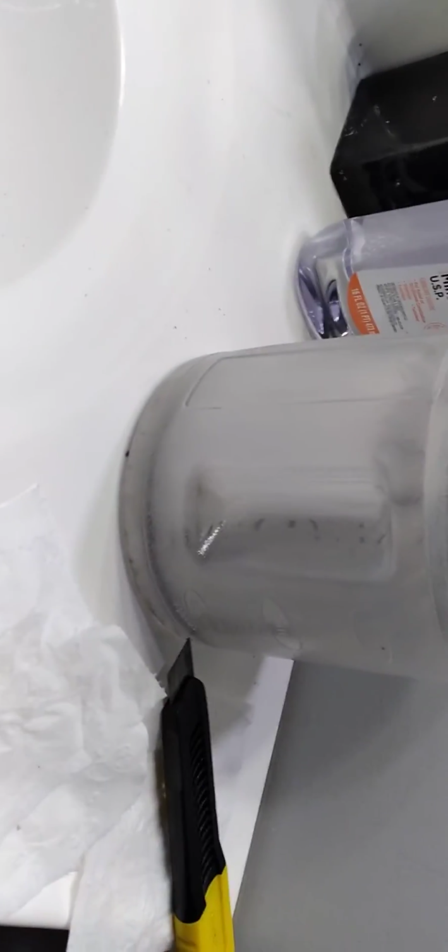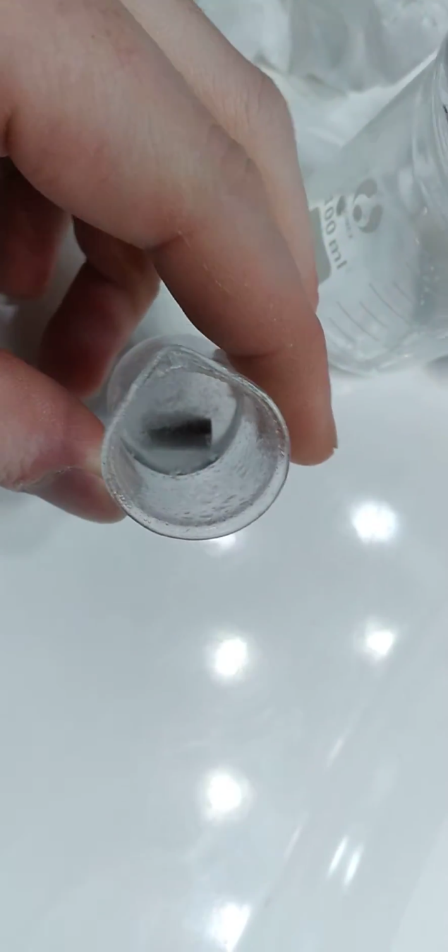Okay, so my last attempt to clean the niobium cylinder failed miserably. However, the past several hours, I've been letting it soak in sodium hydroxide. And I made it from scratch because I have my big container of sodium metal. And I've just been adding more and more sodium to this small amount of liquid and getting it really, really concentrated. And as you can see, it's gray.